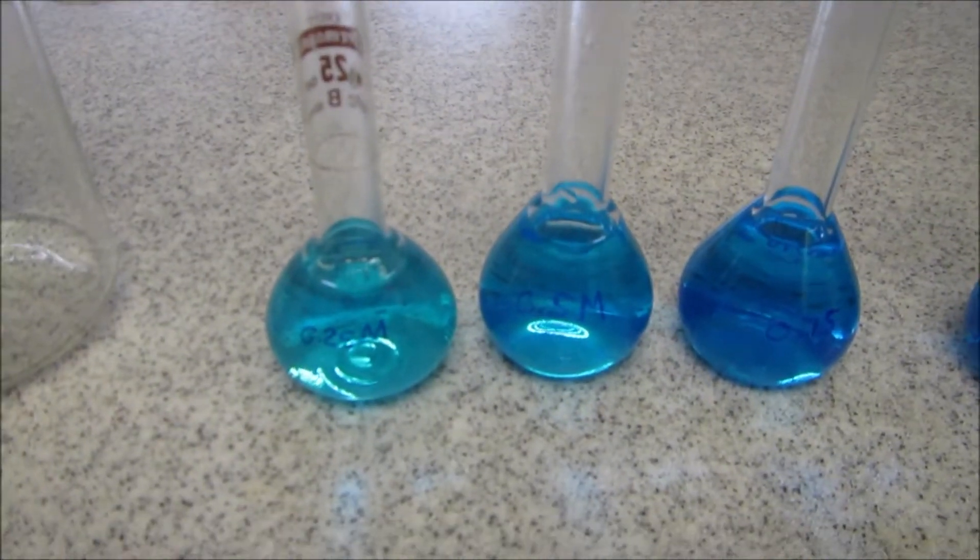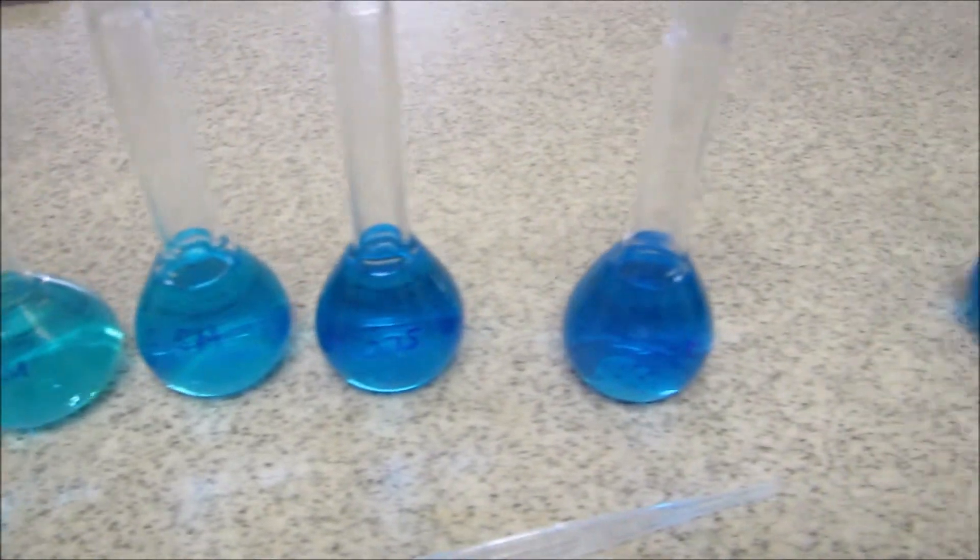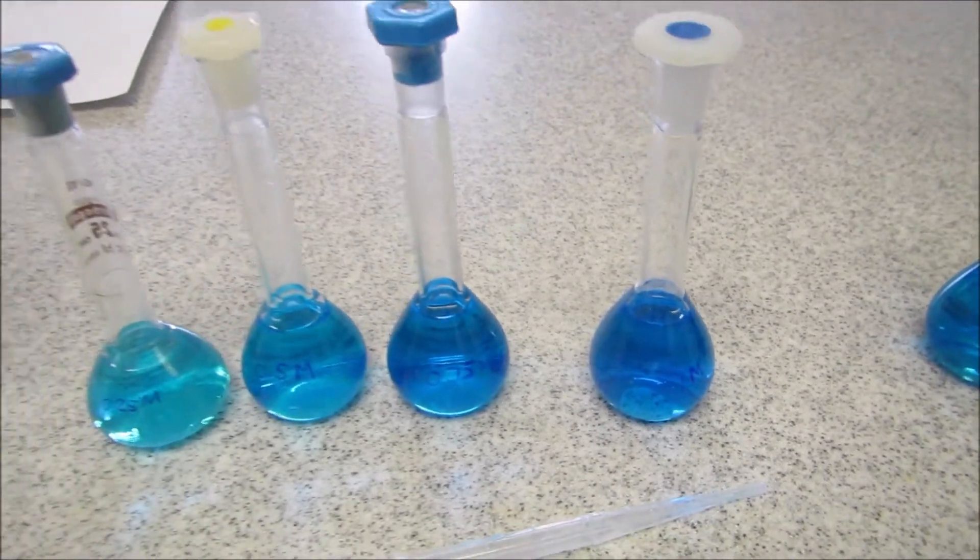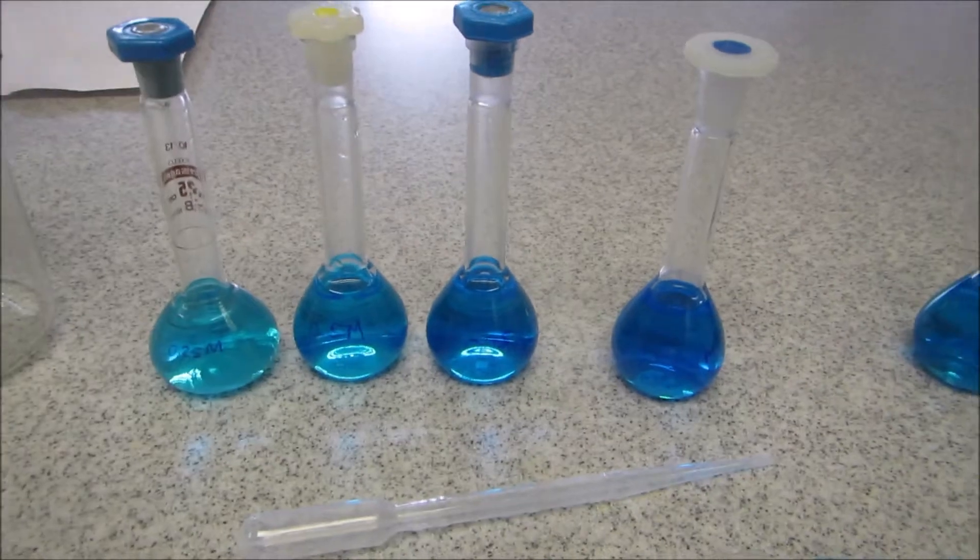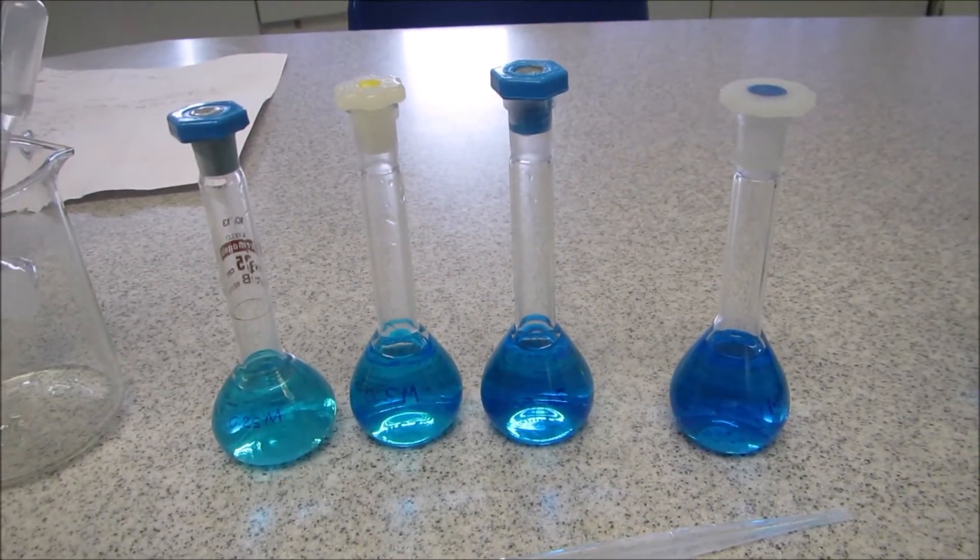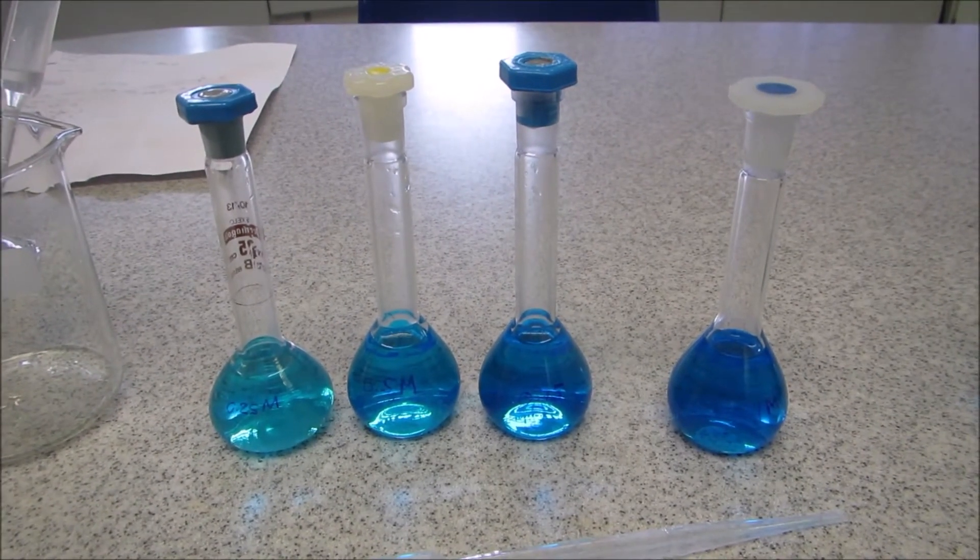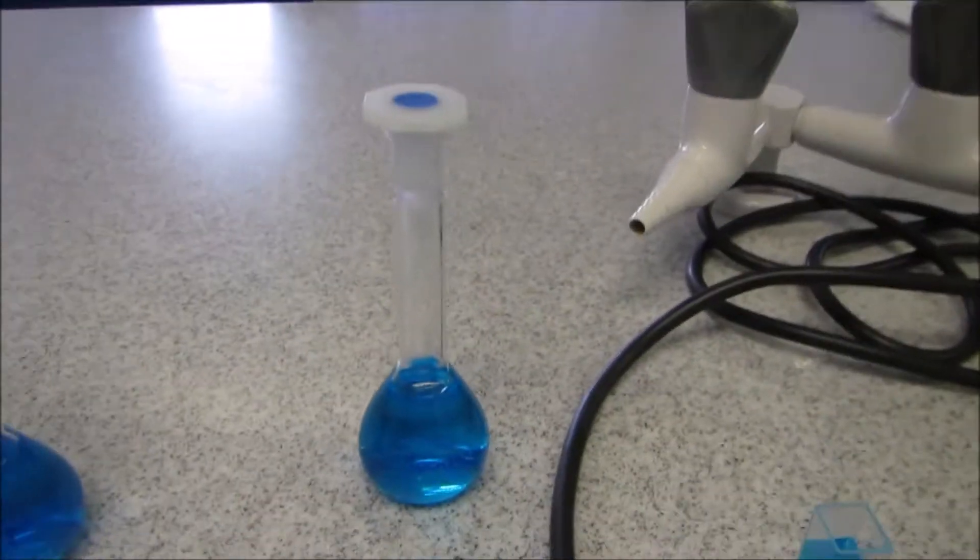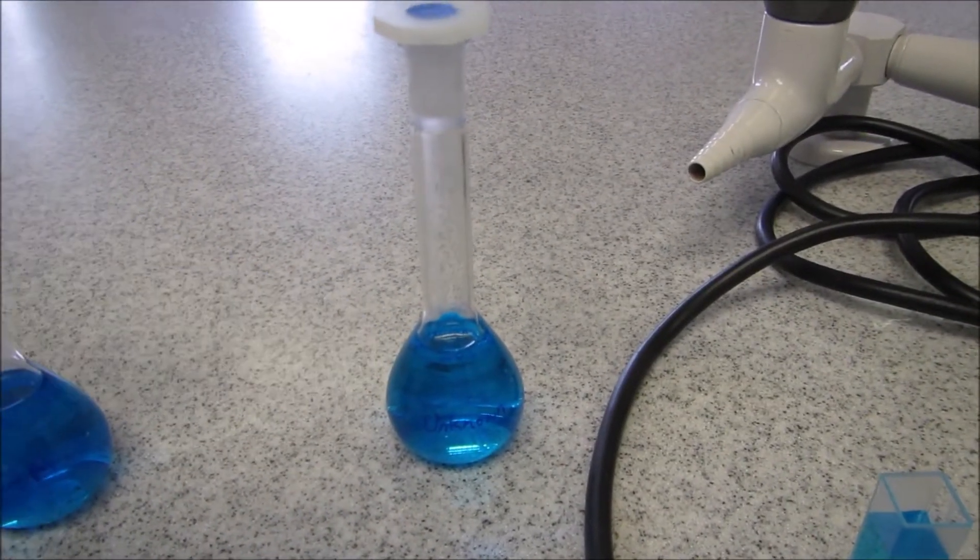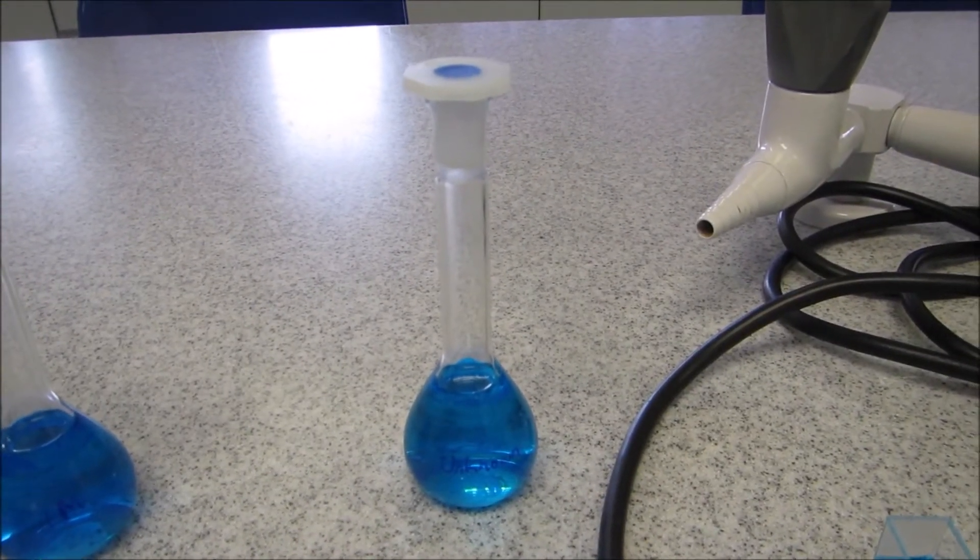I've already prepared copper sulfate solutions ranging from 0.25 molar right up to 1 molar. We're going to use these to create what is known as a standard curve, and with the standard curve we'll be able to detect or estimate the concentration of our unknown solution.